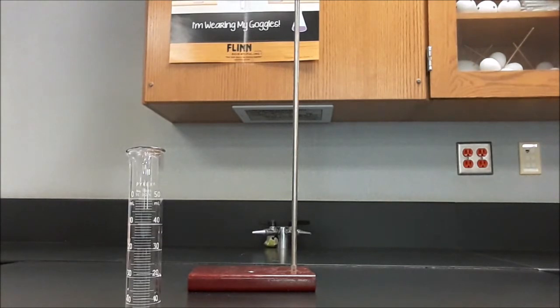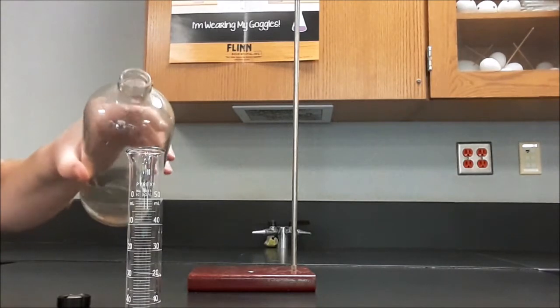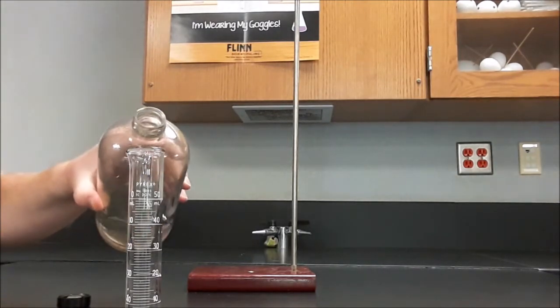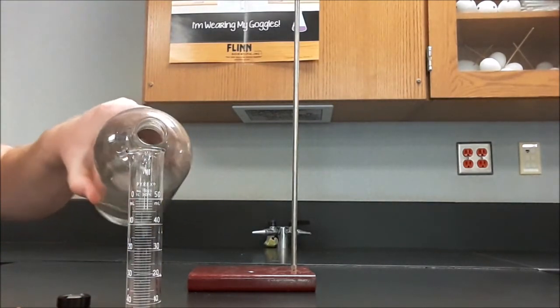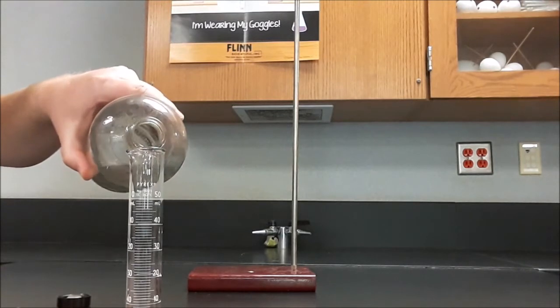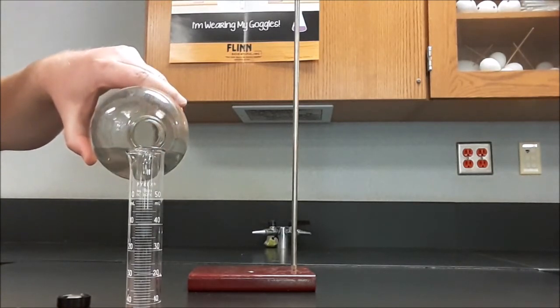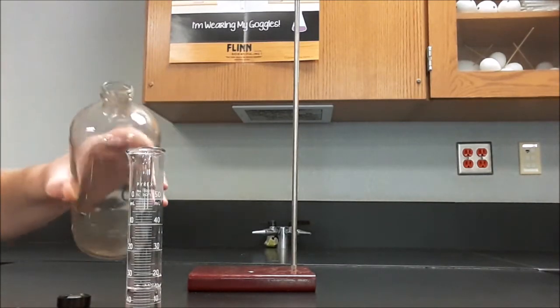So I'll take one liquid and I'm going to measure out 15 mL. And I'm going to pour carefully but confidently. If I'm afraid, if I'm concerned, I'll spill. What I want to do is put the thing I'm filling up down. I want to rest the lip of the bottle on the lip of the graduated cylinder. And I want to pour until the bottom of the meniscus reads 15 mL.